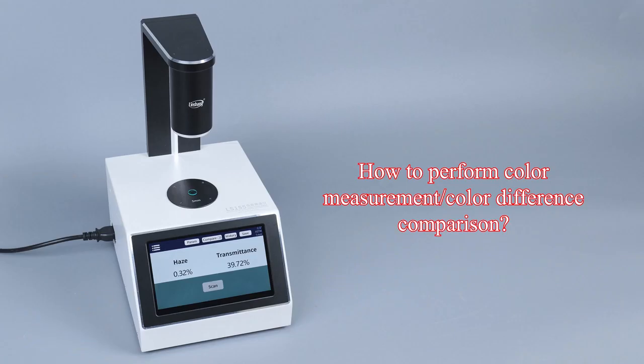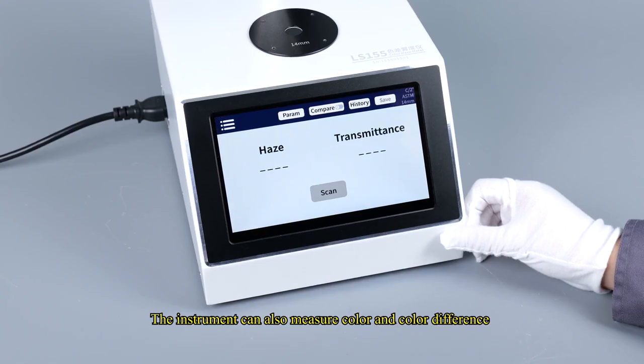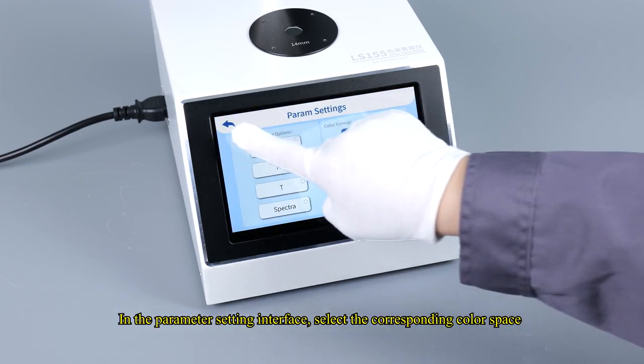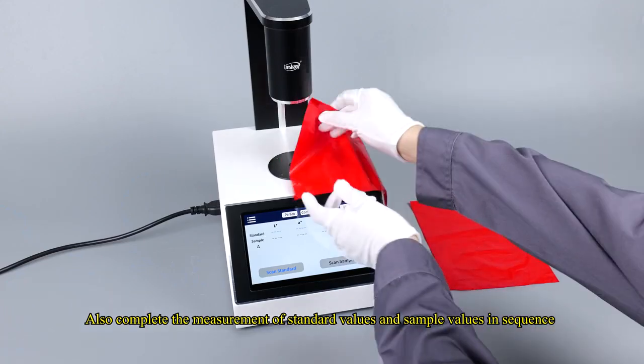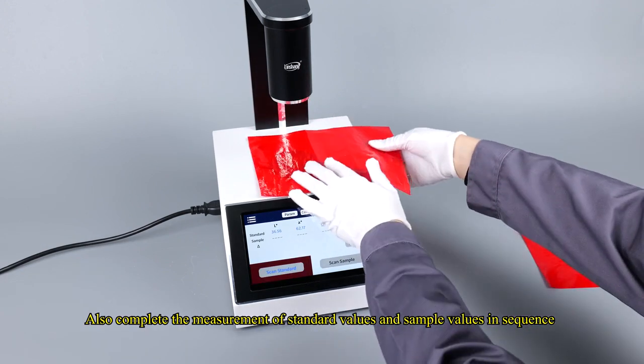How to perform color measurement/color difference comparison. The instrument can also measure color and color difference. In the parameter setting interface, select the corresponding color space. Enter the color difference measurement interface by default. Also complete the measurement of standard values and sample values in sequence.